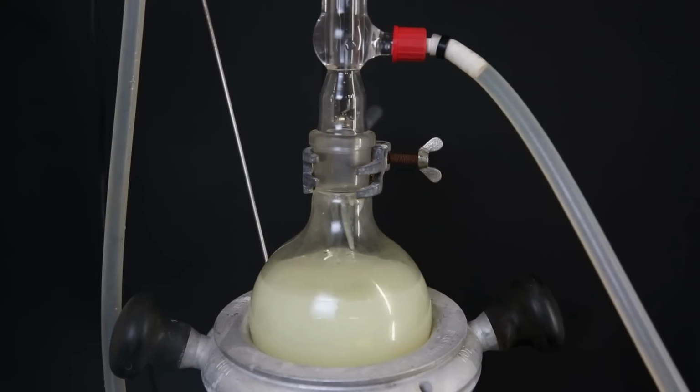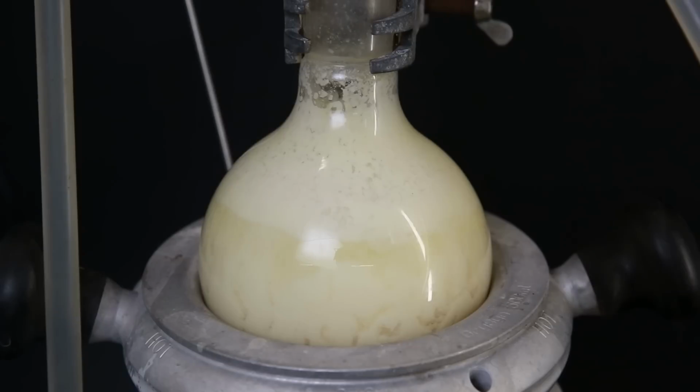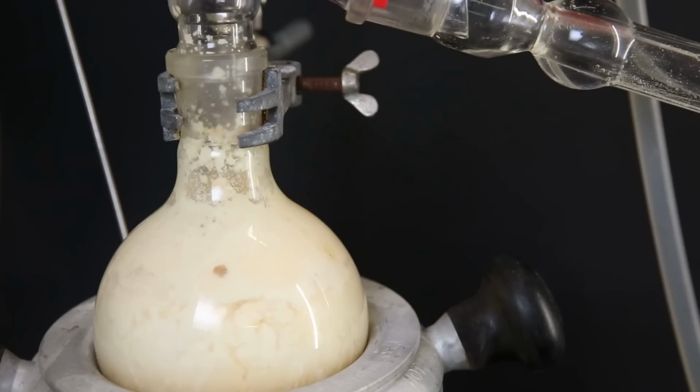But at this point I was scared by what I saw. Somehow it started producing some nasty floaty bits and I didn't know what it was. At this point I was afraid it was going to fail and make me waste all of my chemicals and time. As the reaction went on, more and more solid stuff started to appear, and for a little while it was refluxing, but quickly it seemed like only solid stuff was left over, and I was mentally preparing myself that it could be ruined. But in my last hope to save it, I started doing the workup anyway.